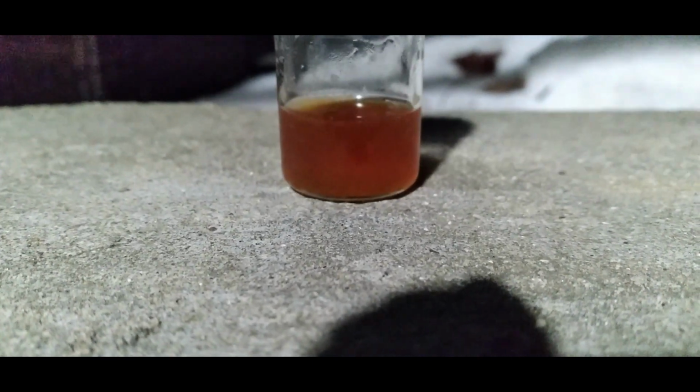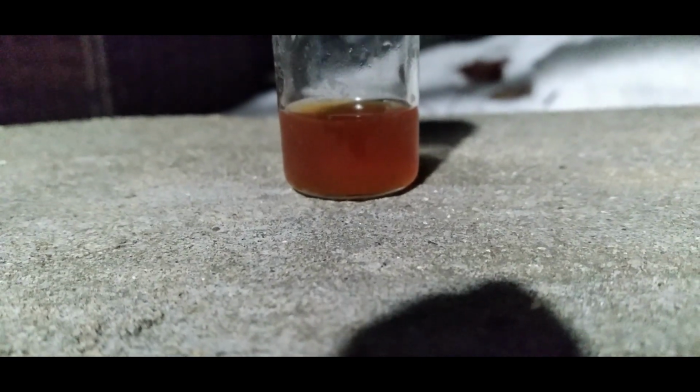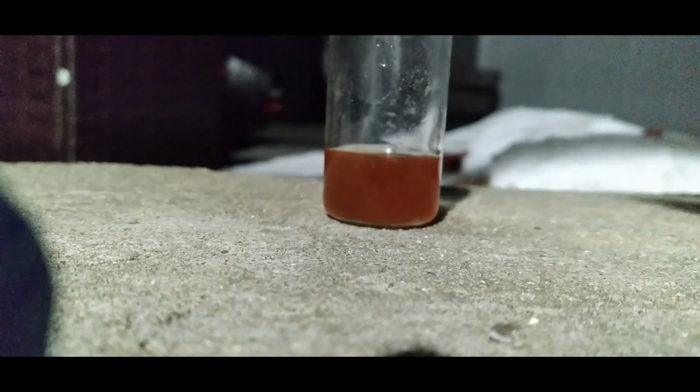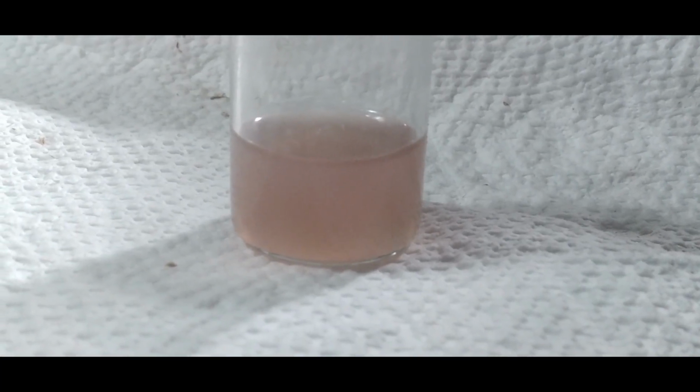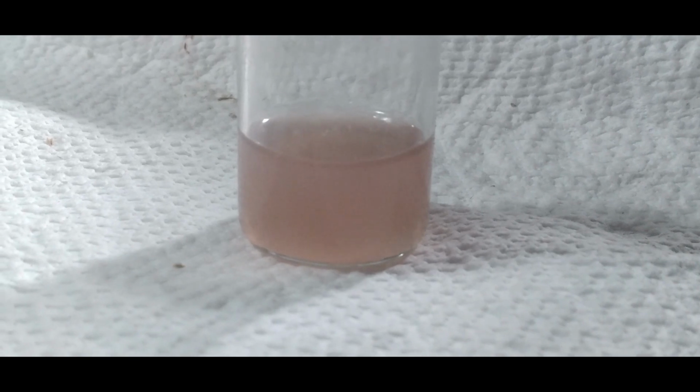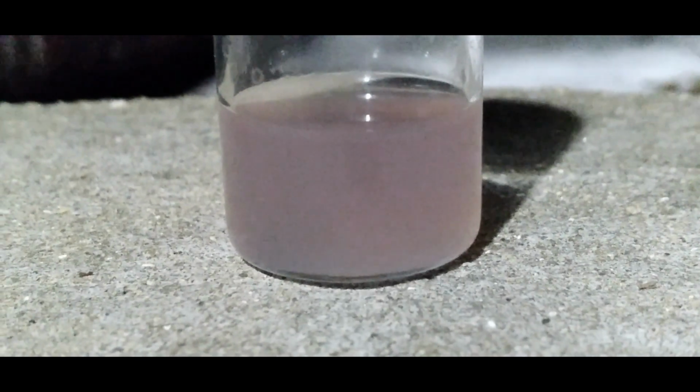Now, on several occasions, as the solution lightened, I was able to make it go red again by simply swirling it. I found this very interesting and amusing. Eventually, it stopped doing this and fully committed to changing color. First going to a light peach and then eventually pink.